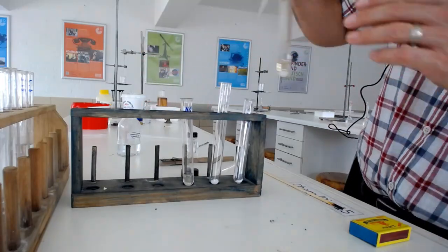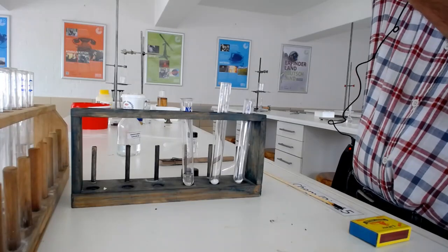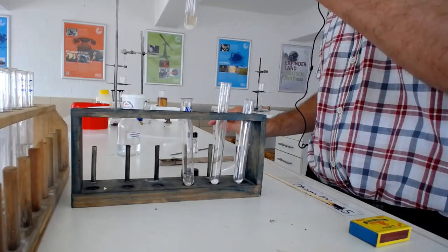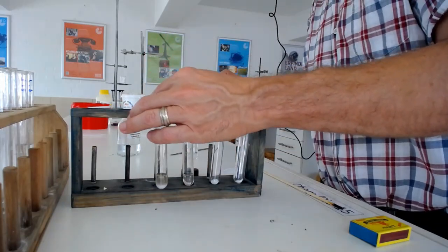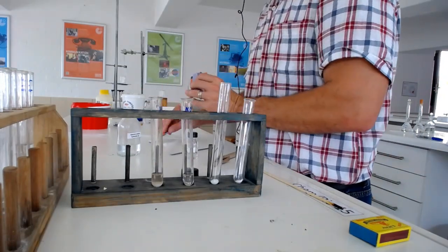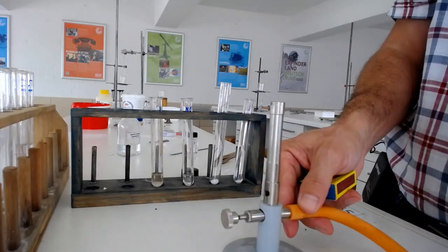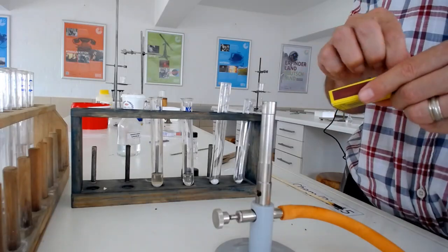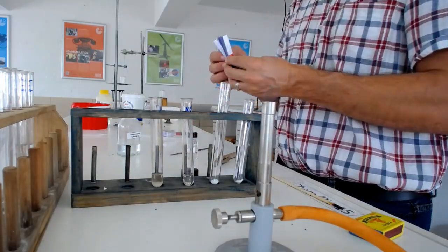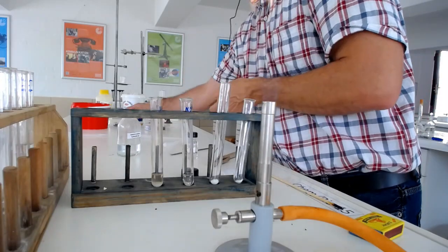Okay, so there we go, this is more or less what we expected. I actually used this in a previous experiment just now for the heating, but what happens now is that on heating this it should liberate ammonia gas. So let's ignite our flame and then see what we can get.